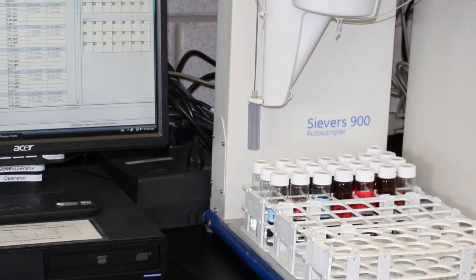Once the test is completed, the analyzer will report the concentration of dissolved or total organic carbon.